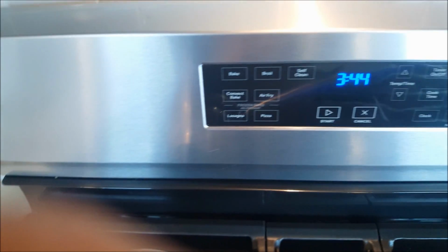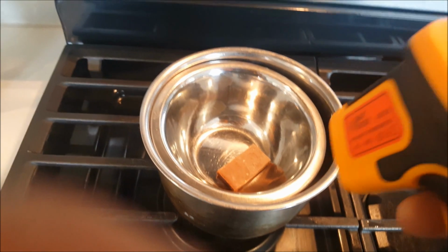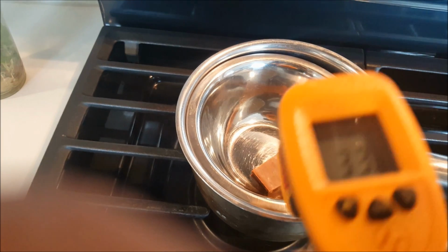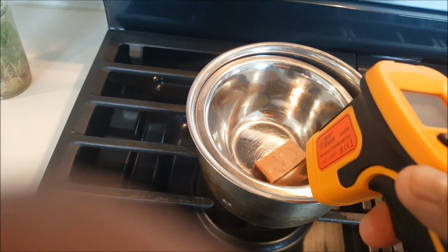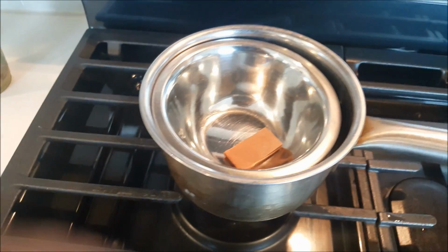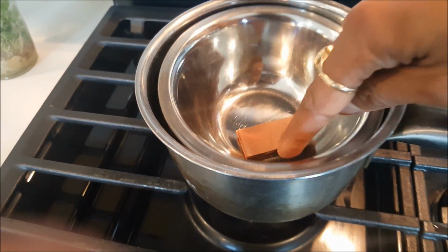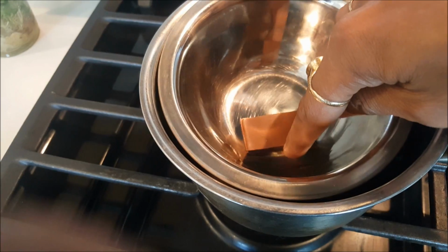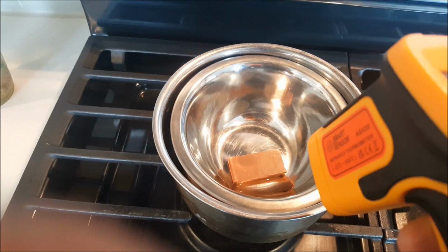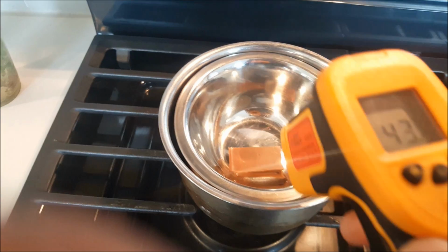So here you can see it's 43, 44, 1 minute almost, and then 35, 33, 39, and I'm not seeing anything from the side. Actually it starts melting. You can see it start melting if I touch it. So here you can see it start melting also. So what is the temperature? 40. So this chocolate starts melting around 40 degrees Celsius.